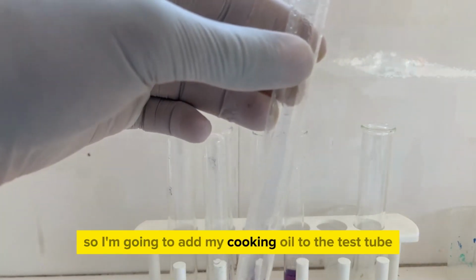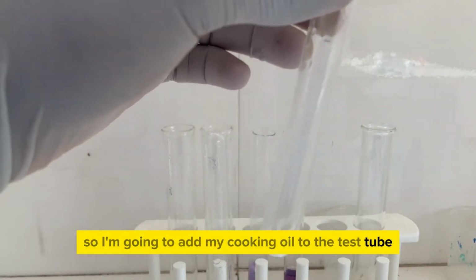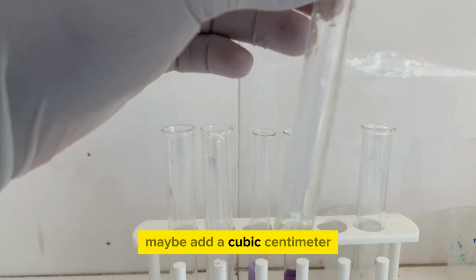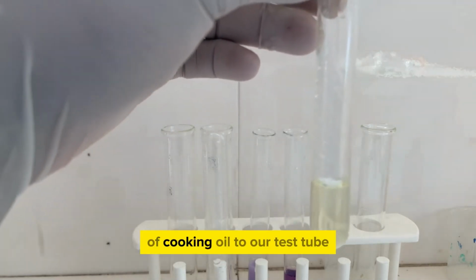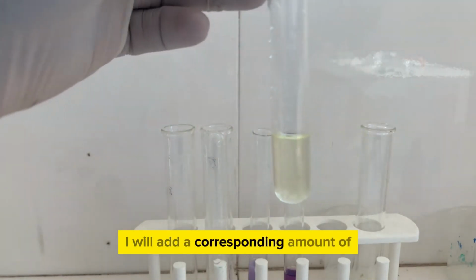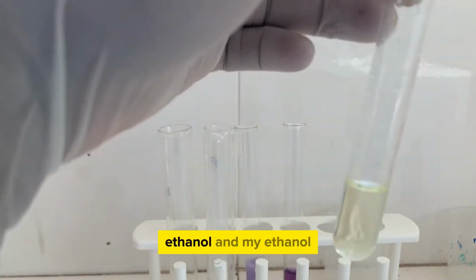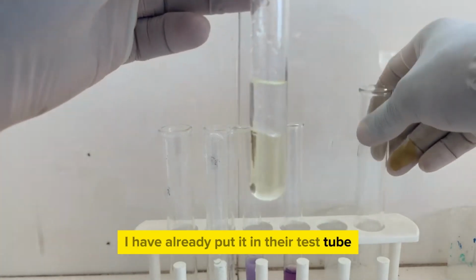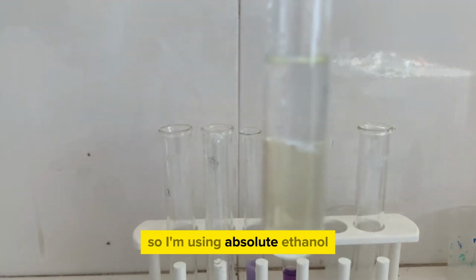So I'm going to add my cooking oil to the test tube. This is normal general cooking oil. Maybe add a cubic centimeter of cooking oil to our test tube. Next, I will add a corresponding amount of ethanol. My ethanol, I've already put it in a test tube, so I'm using absolute ethanol.